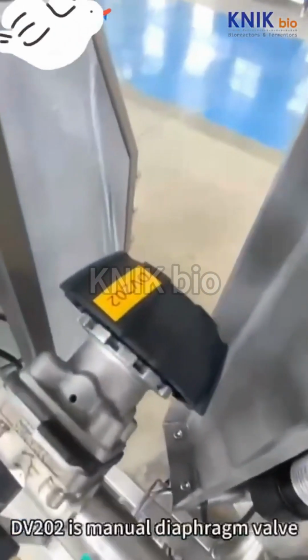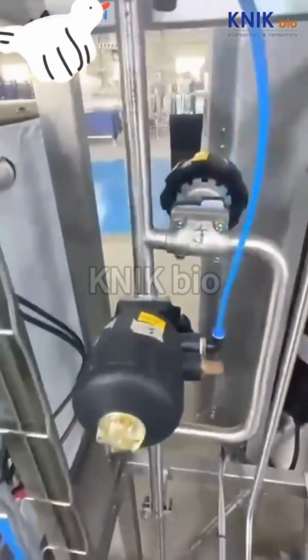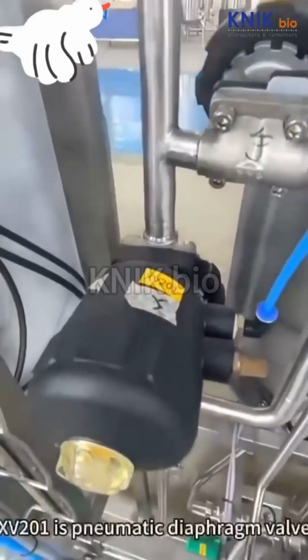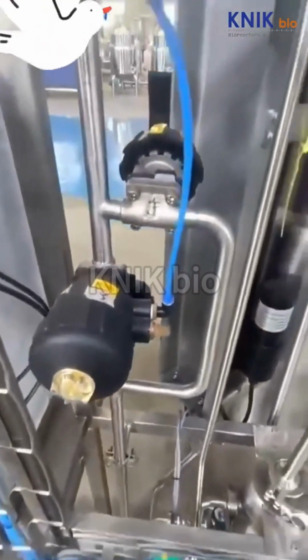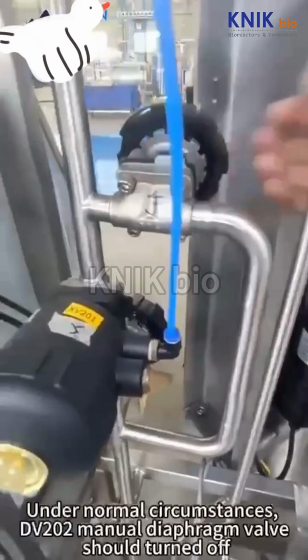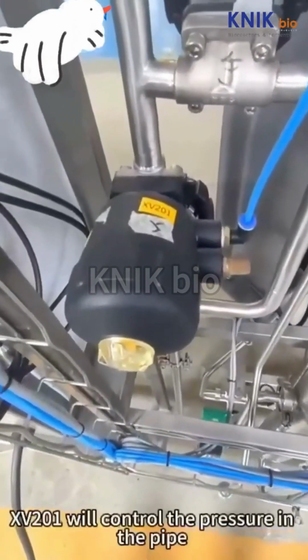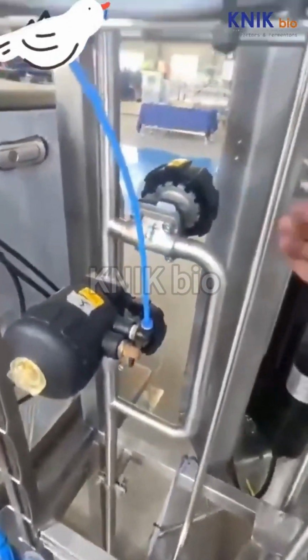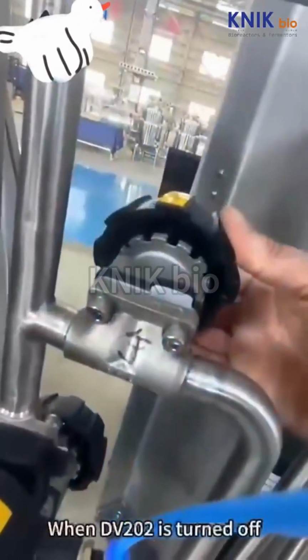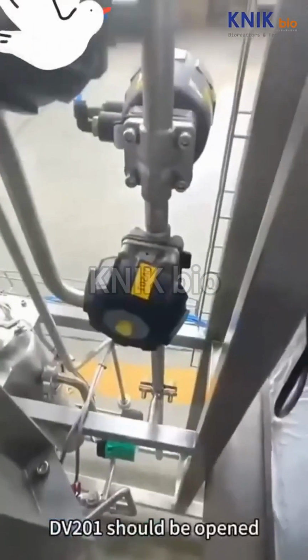DV202 is a manual diaphragm valve. XV201 is a pneumatic diaphragm valve. Under normal circumstances, the DV202 manual diaphragm valve should be turned off. XV201 will control the pressure in the pipe. When DV202 is turned off, DV201 should be opened.